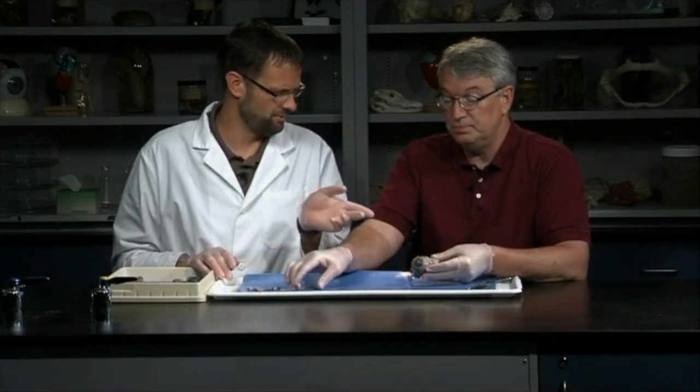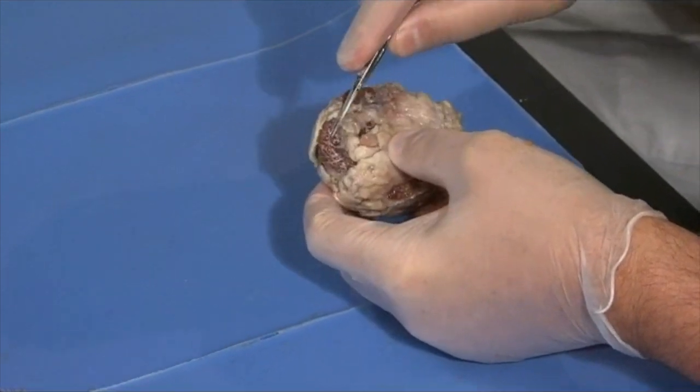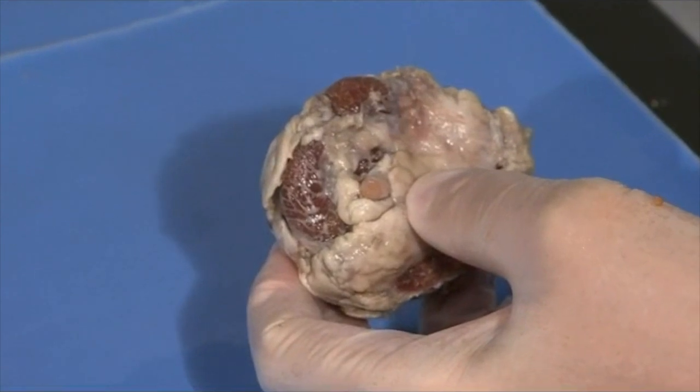What's nice too is when the kids start dissecting this, you can tell the difference between the connective tissue, muscle, and fat. Yeah, and in fact you can already see on the back here the fat, of course, and then these reddish structures with the striations are muscle. These are the extrinsic muscles which control the movement of the eye, so you can move your eye to the side and up and down. In the cow, these muscles are relatively large.